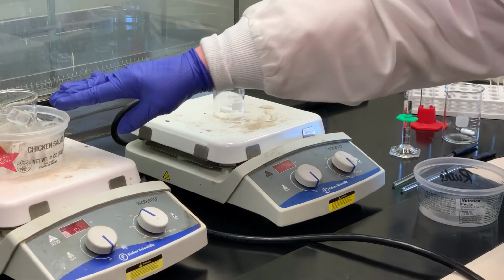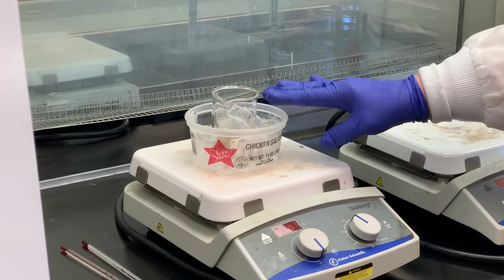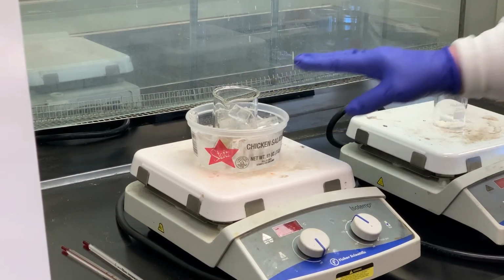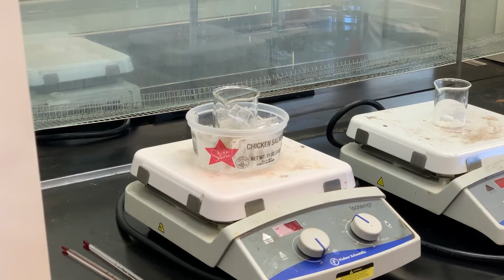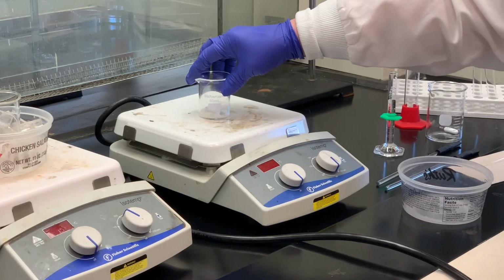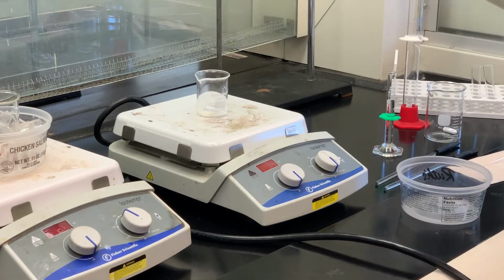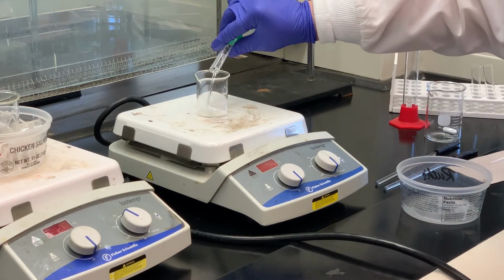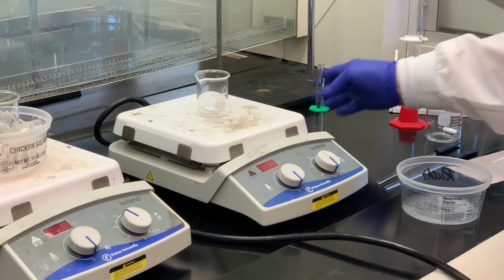I have the para-nitroaniline that has the water and the hydrochloric acid. I put that in an ice bath and waiting for that to chill down to 0 to 5 degrees. I need to make a solution of 1 gram of sodium nitrite and 5 mils of water. I have a little bit over that, 1.011 grams. I'm going to add the 5 mils of water to that and then dissolve that up.